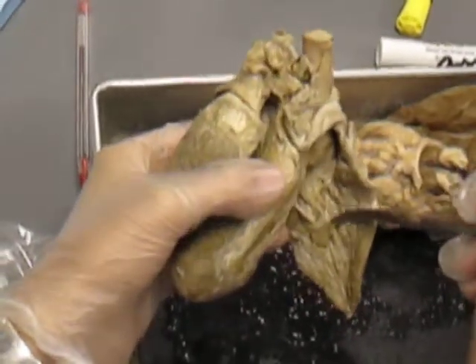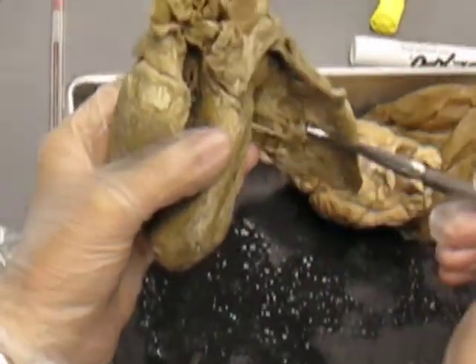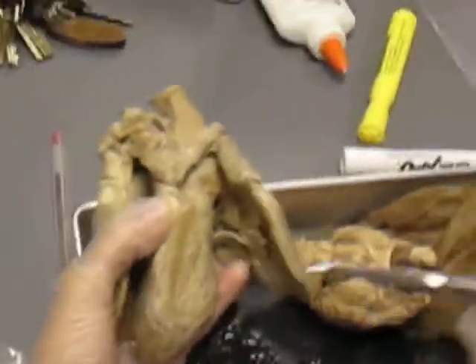They attach to papillary muscle, which are supposed to look like nipples. Yay! According to whatever male decided that heart muscle looked like nipples. Pervert.